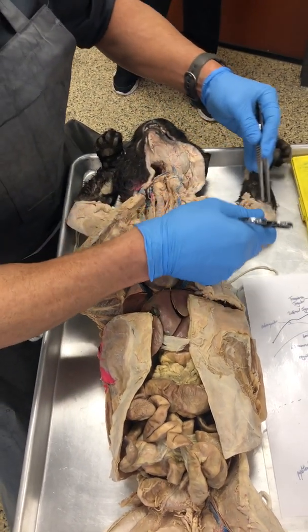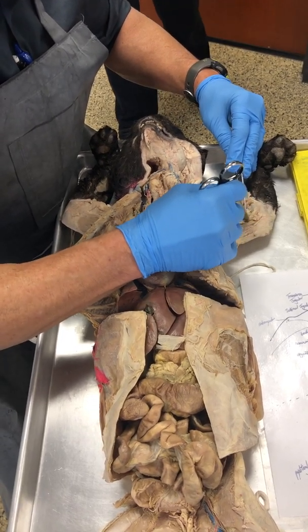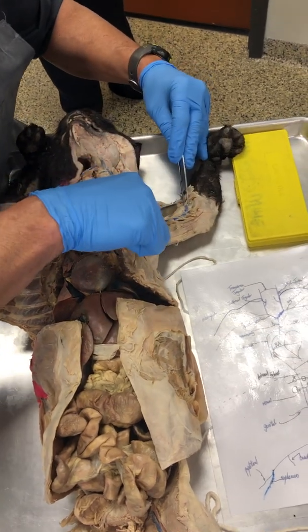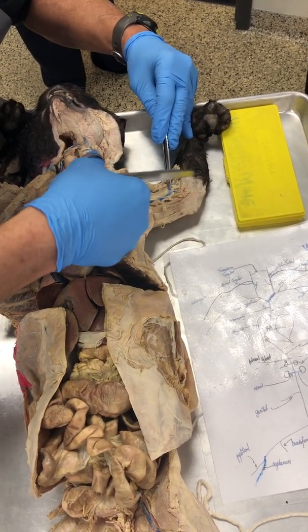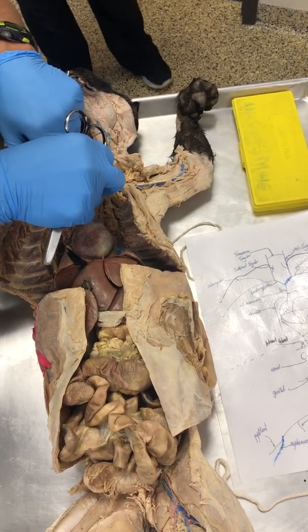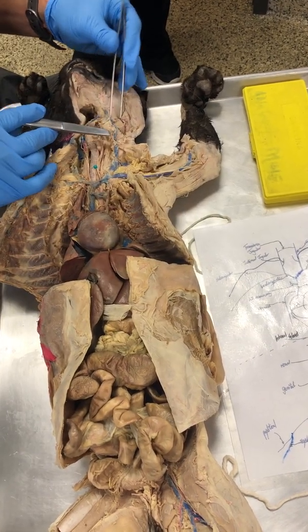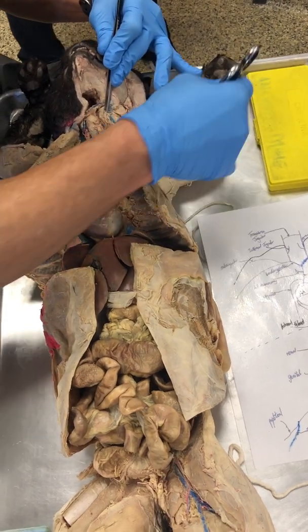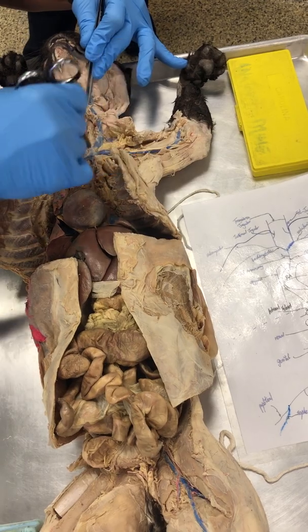Now we come to this one in the arm. So let's have a look here, folks, in the arm. All right, there we go. That's what I'm looking for right there. In the arm, there's brachiocephalic, which is the point of reference. There's the Y. External jugular drained into one section of the Y. Now this right here is one blood vessel that drains in there.